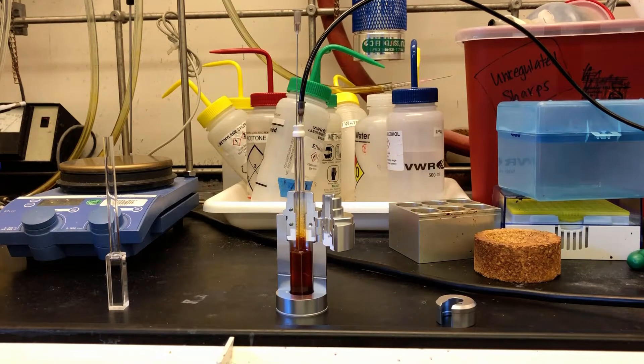This sample holder is also useful if you'd like to flow nitrogen to remove dissolved oxygen before measurement. Just use a rubber septum with an inlet and an outlet for nitrogen.